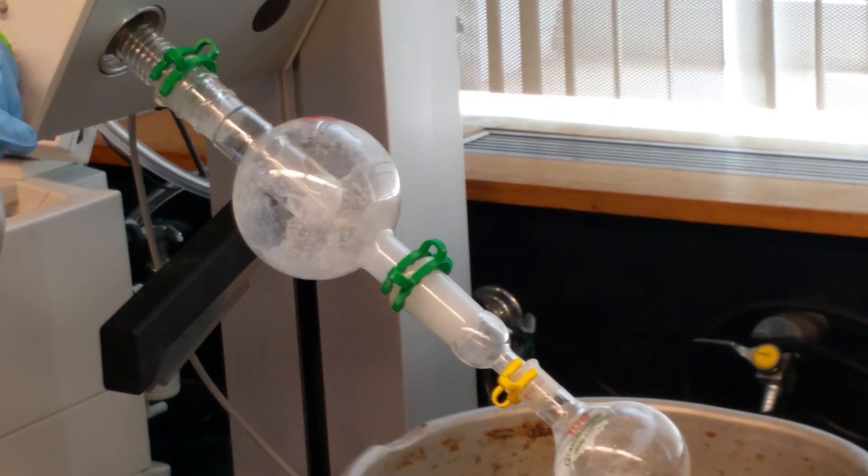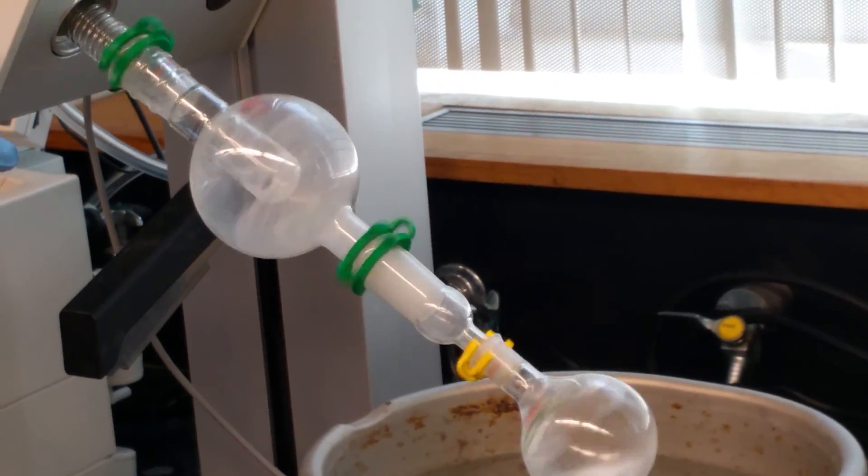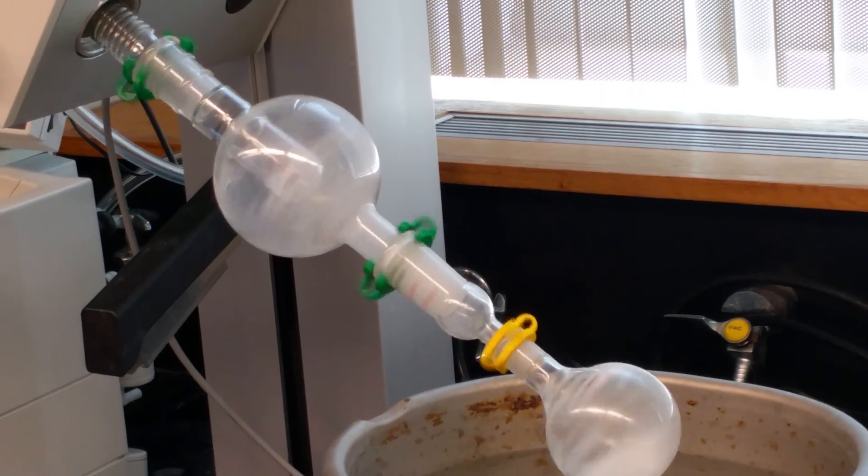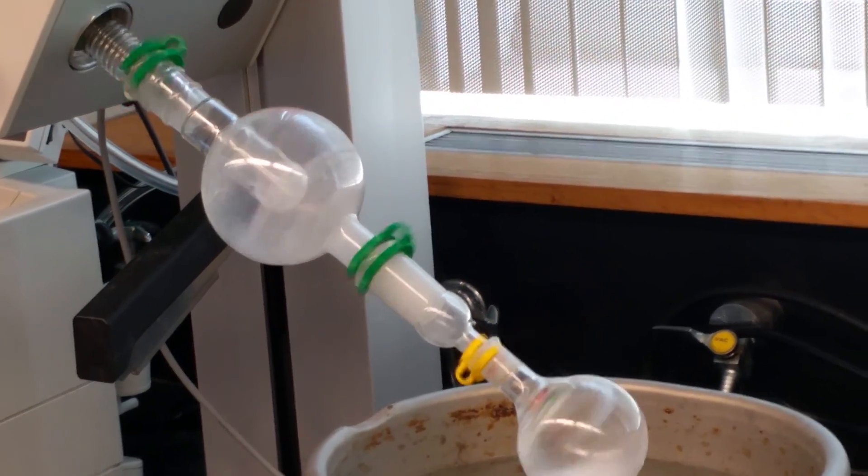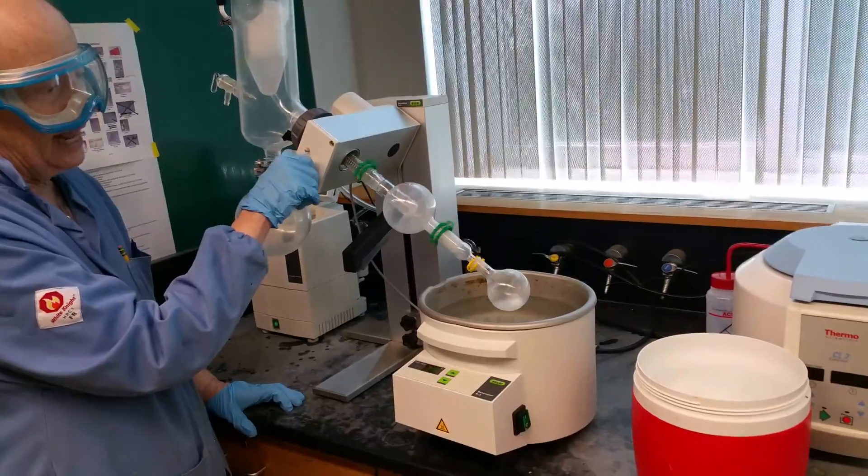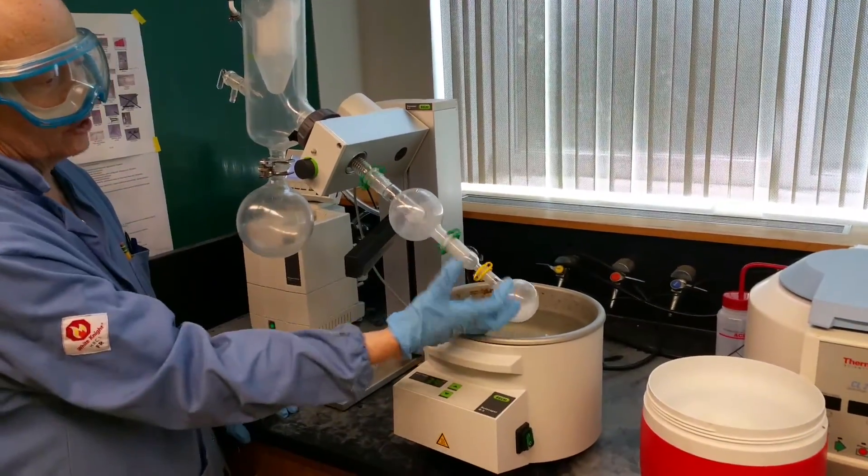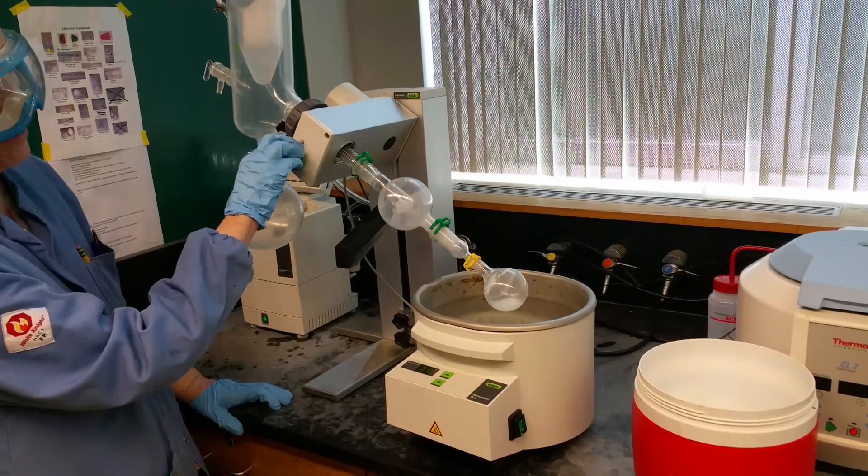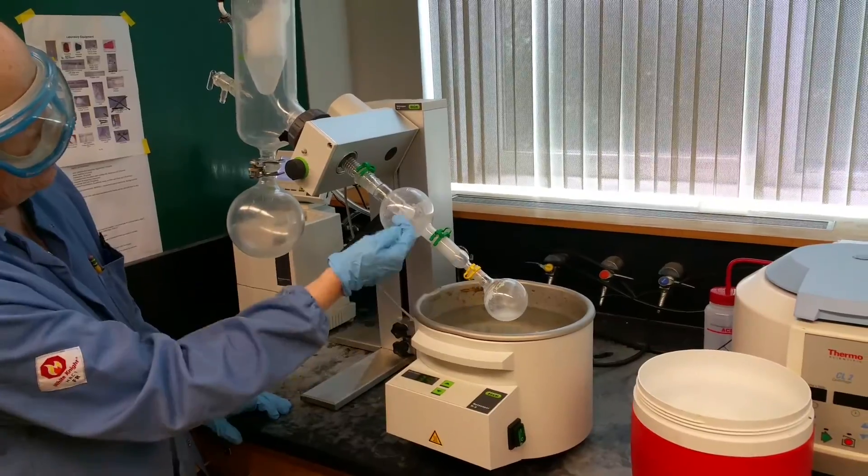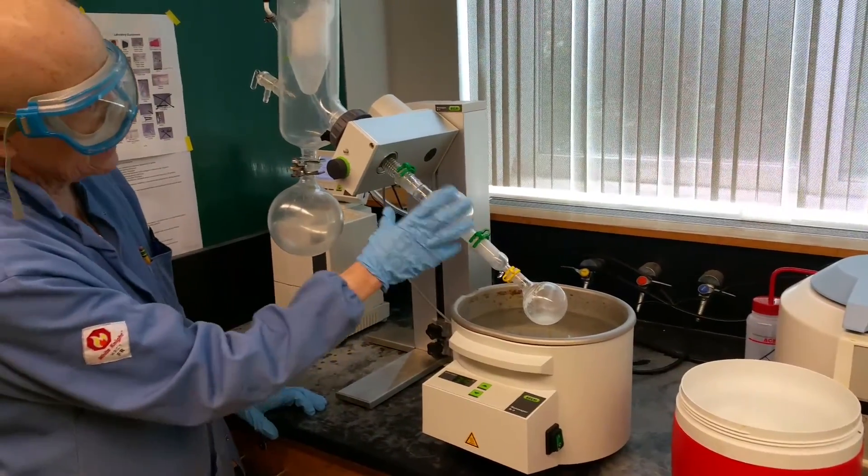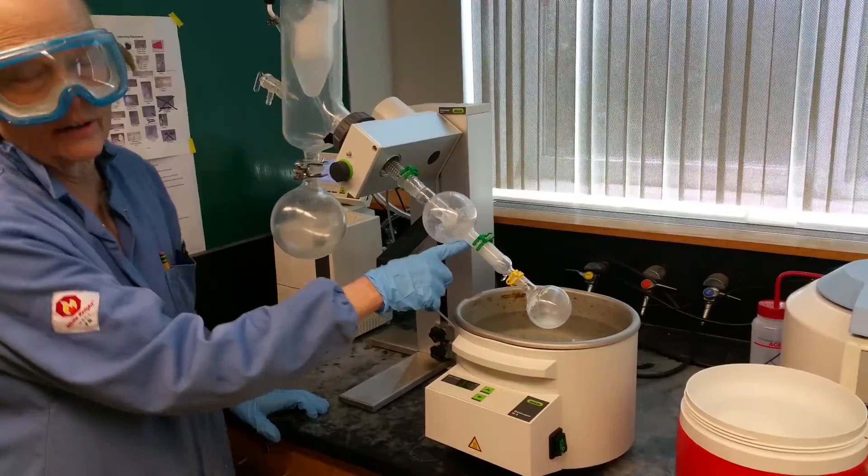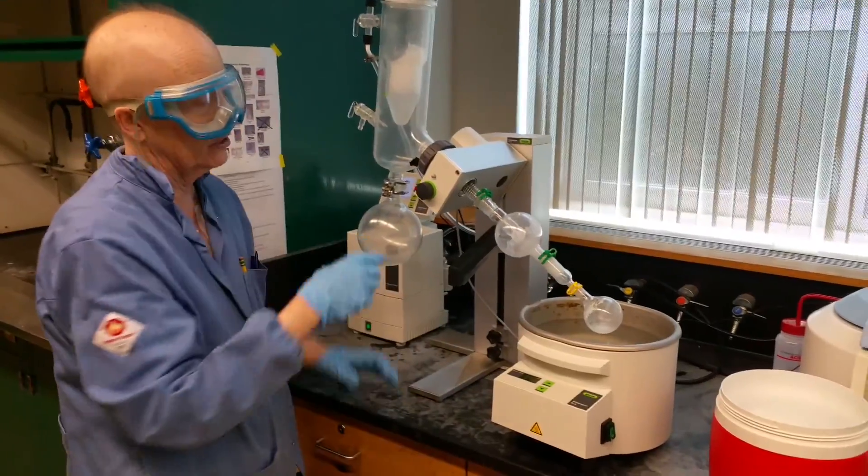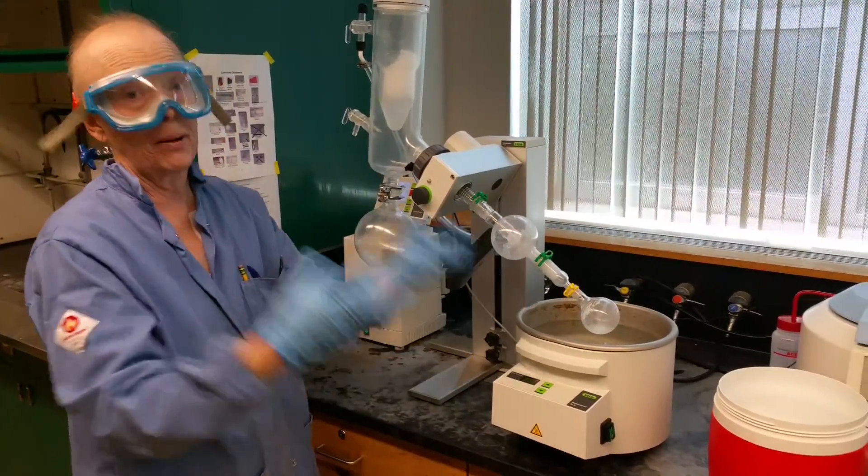So I'm going to start it again. I just turned the pump on. Putting the sample on. Clip it. The fat part of the clip goes on the bottom. The thinner part goes on the neck of this adapter. Now let's see what it does. So I'm going to turn it up. It didn't bump that time. That's the way it's supposed to start. Occasionally what happens is you just get a large formation of bubbles all at once and it pushes the liquid up.